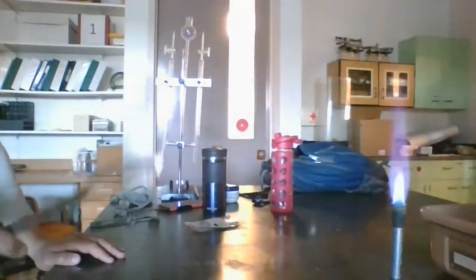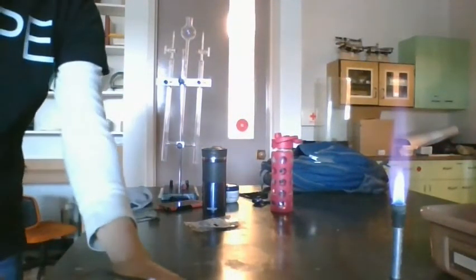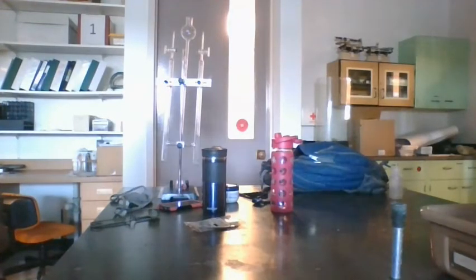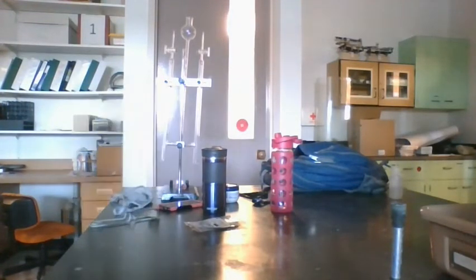Yeah, it's glowing on the screen. I can see that. Okay, so turn that flame off. Put the lights back on.